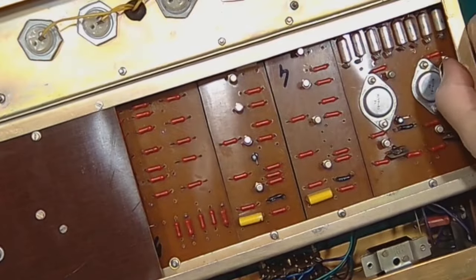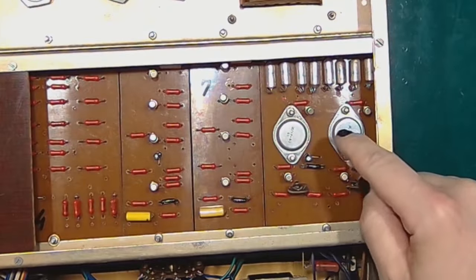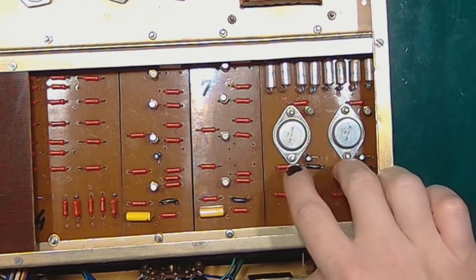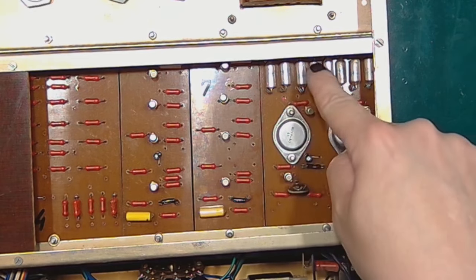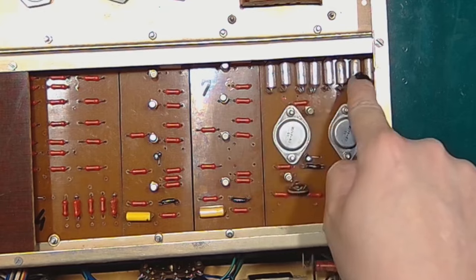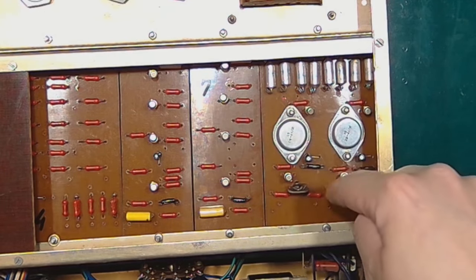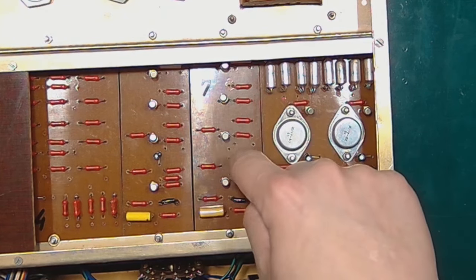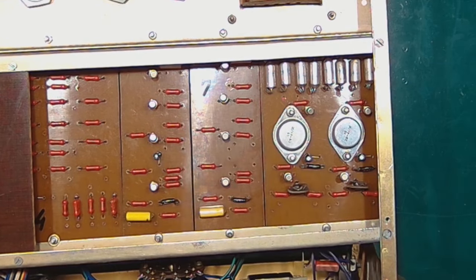So on the bottom side, the power supply board uses the two silicon power transistors together with some TO18 silicon transistors and germanium rectifier diodes. It has two sections, they are identical, and both of them provide plus 13 volts. One goes to this timer, the other one goes to this timer. I'm not exactly sure why they used separate power supplies for both timers. I think that might be because they wanted to ensure that one timing doesn't depend on another.